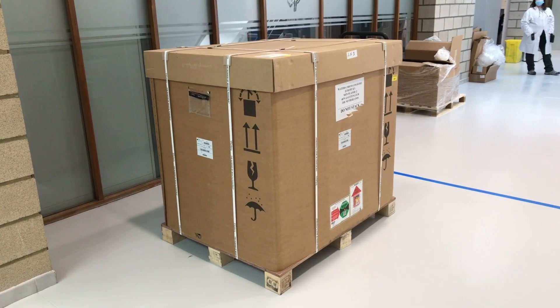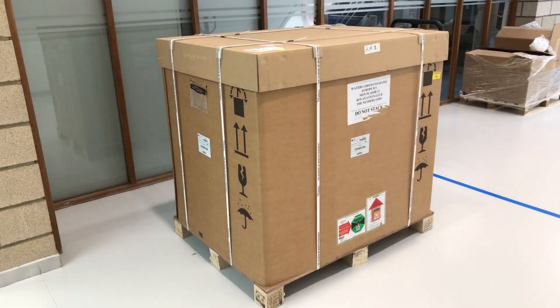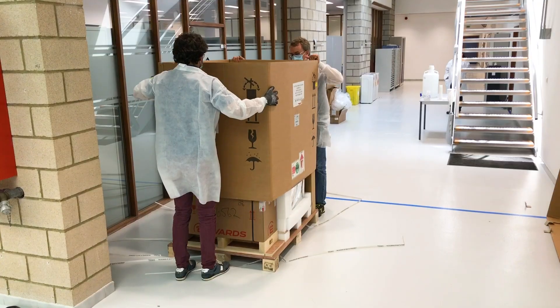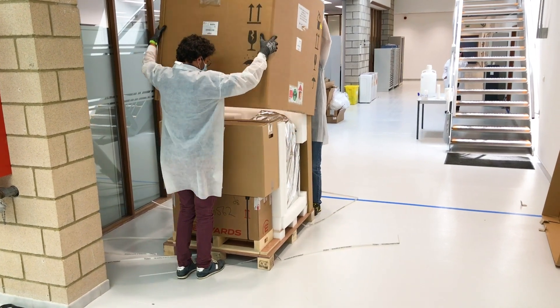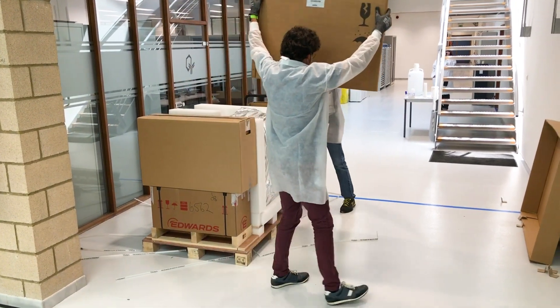It's a lot of excitement to get new equipment, and this tiny equipment in this compact box was exciting. When you receive the BioAccord, you just receive one box. It's completely different compared to other systems where you see several boxes — here it's just one big box with everything inside.